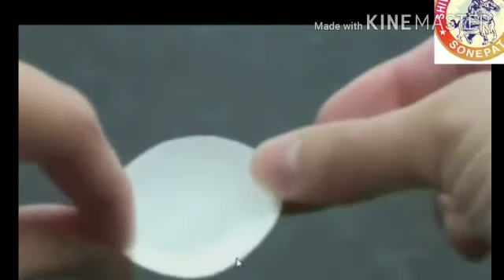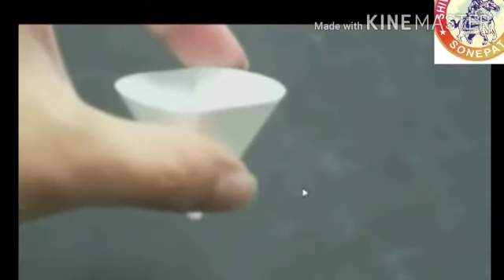Here, filter paper is used for filtering the impure components or impurities which are not dissolved in water. The filter paper is used by folding it in a specific way. This filter paper should be put in a funnel so that we can use it as a sieve — just like we separate tea leaves from tea. In a similar way, we can separate the insoluble impurities present in copper sulfate.